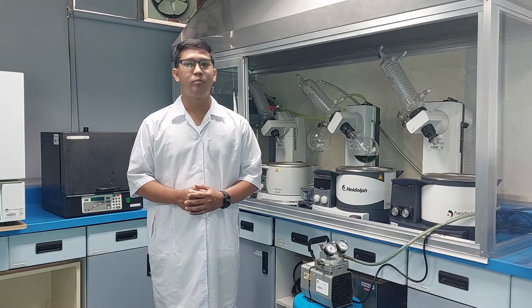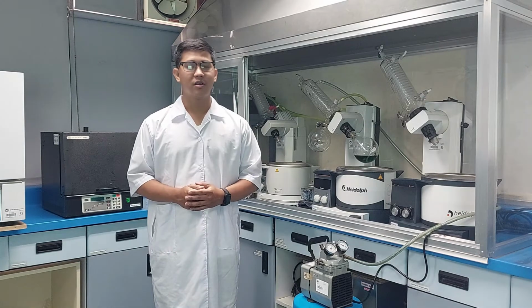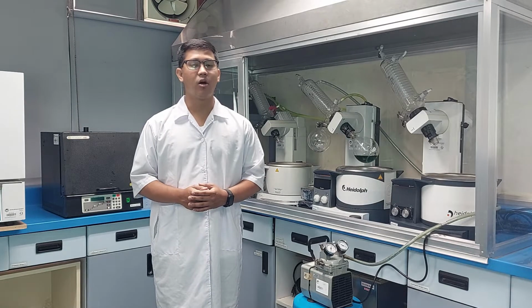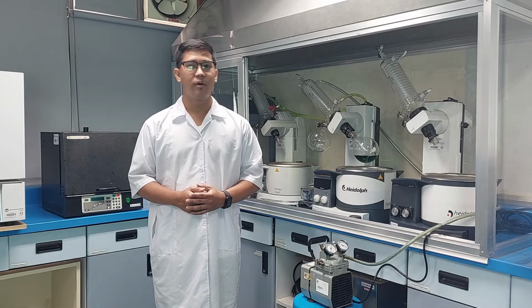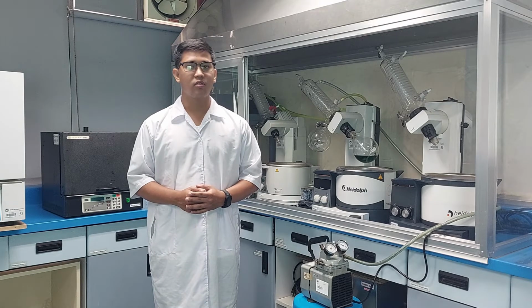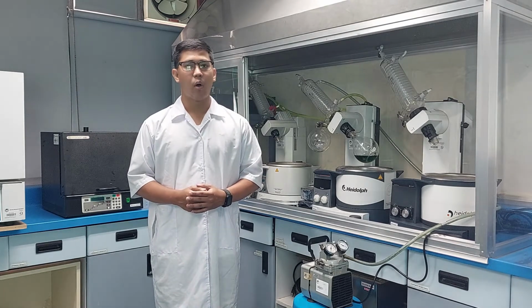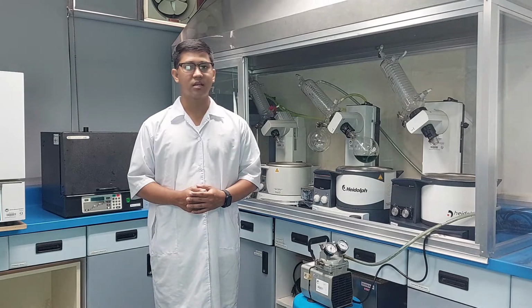Check all glassware for visible chips, cracks, or scratches before using. Handle glassware with care at all times. Always ensure that flasks, bump valves, and ground glass joint connections are secured to the unit with clamps or keck clips as appropriate. The water bath temperature should not exceed the boiling point of the solvent.